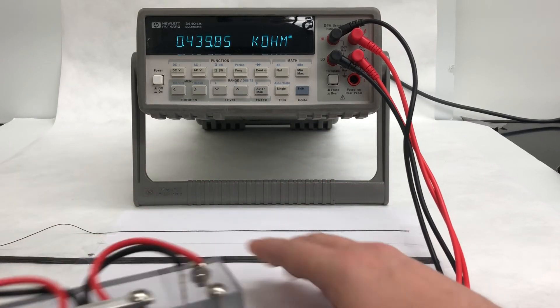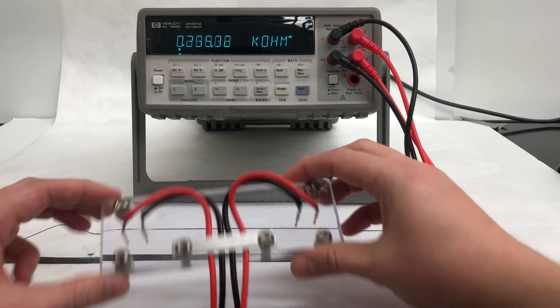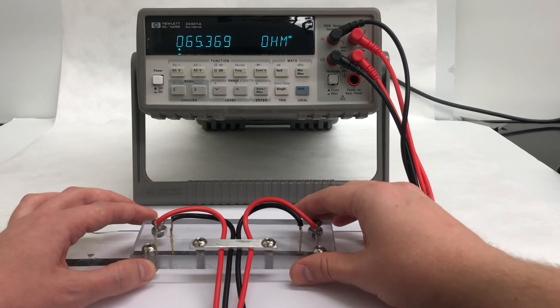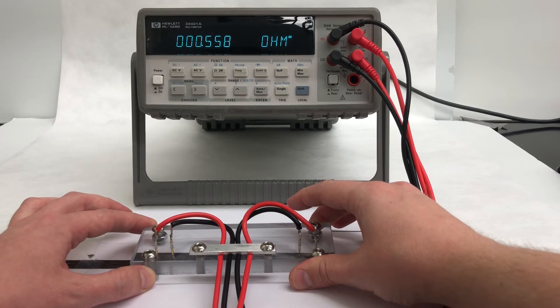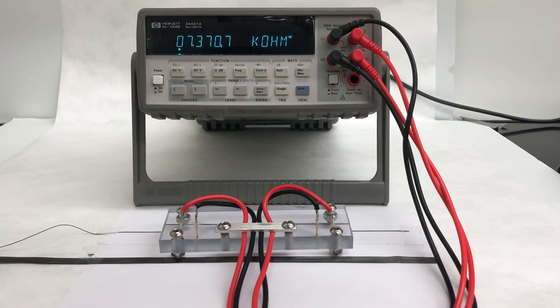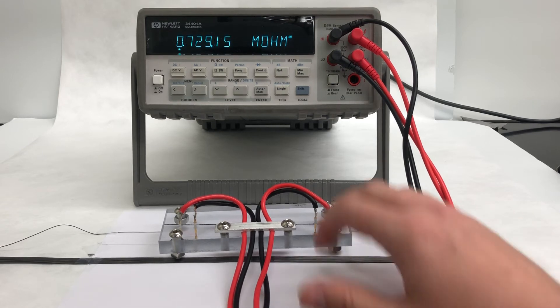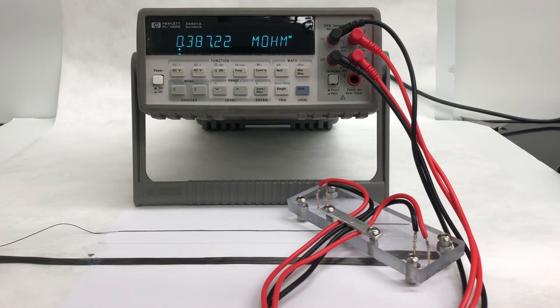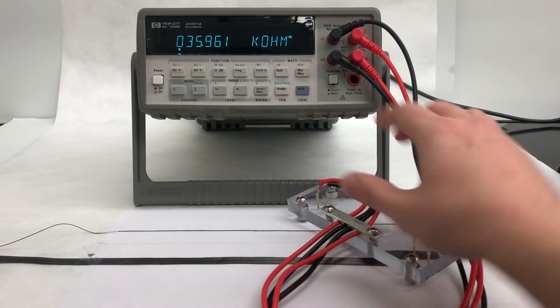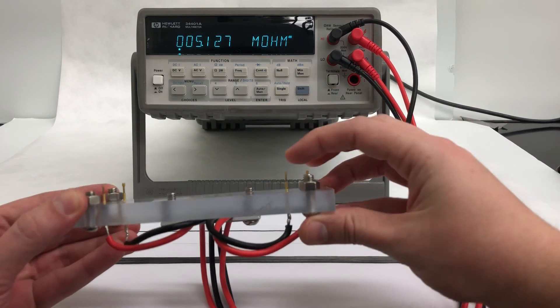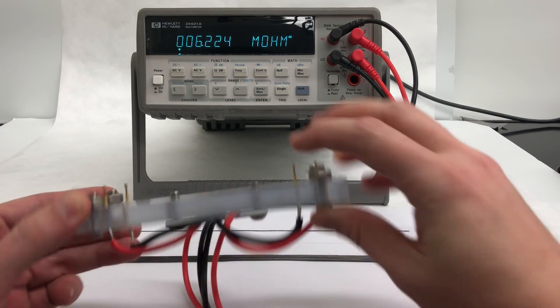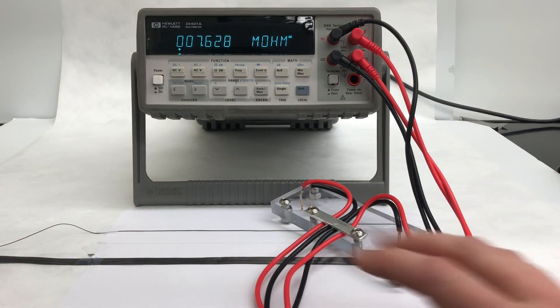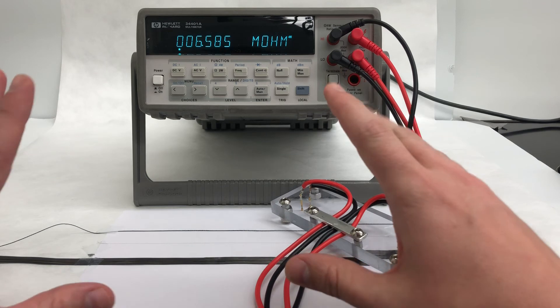And then finally, here's an example of our narrow carbon nanotube tape. Now, we've posted some videos recently showing off our wider carbon nanotube tape formats. It's important to note that once you go to a sufficiently wide tape, a probe like this that has these relatively closely spaced point contacts won't give accurate results anymore, because the current won't be able to spread through the full width of the tape.